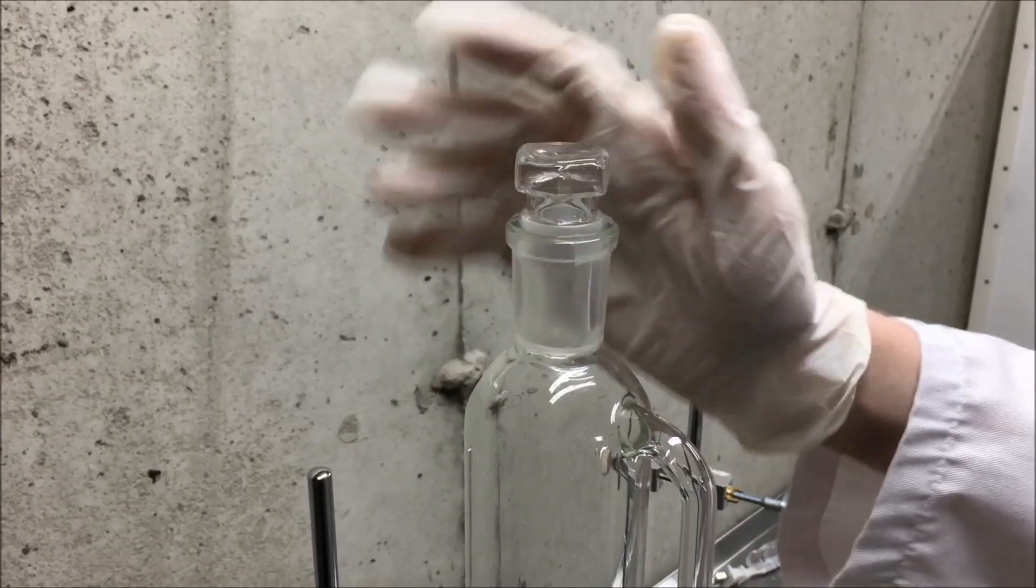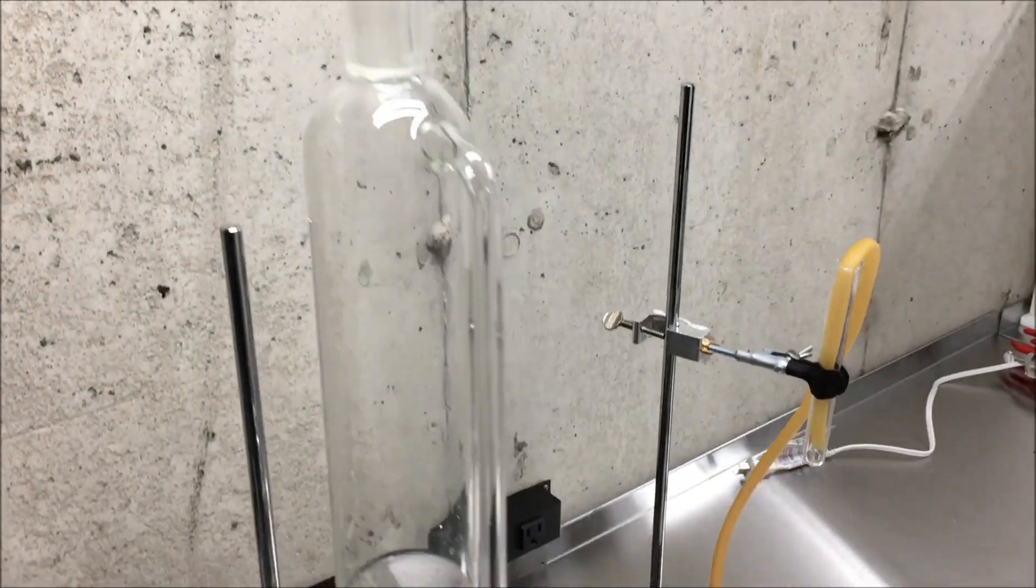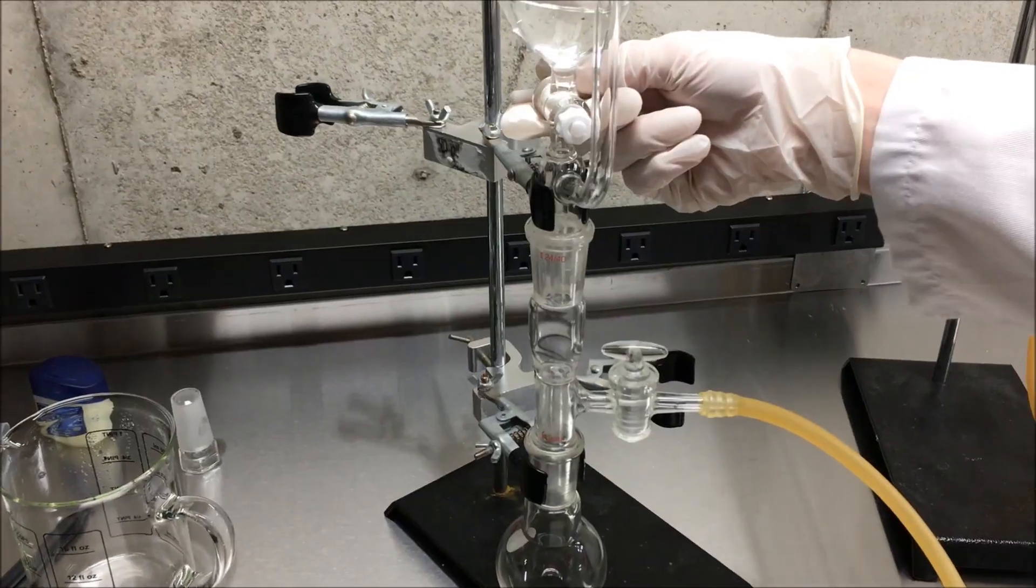I then stoppered it, made sure it was all sealed, and ran the hose into a small test tube to be filled with oxygen.